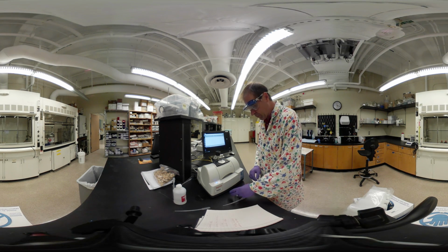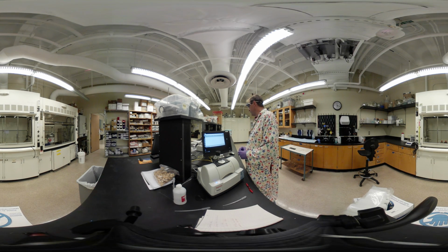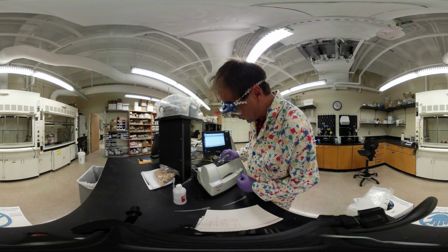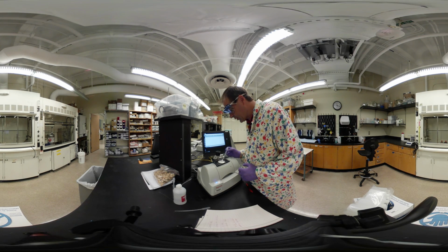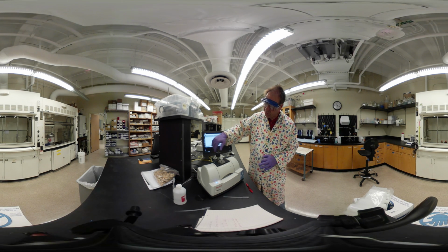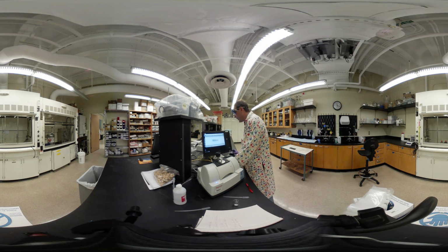So we've taken our background, and then we want to take our sample here, and it takes just a very tiny bit of the sample. We can just put this right on the window there. We just want to make sure there's a little bit of white powder on the window. Okay, so we move this into place. Now for a liquid, we could just take the measurement. For a solid, we want to push down and make sure there's good contact. So you just spin this until it starts to vibrate a little bit. Our sample's there. Okay, so now we're going to say collect a sample.